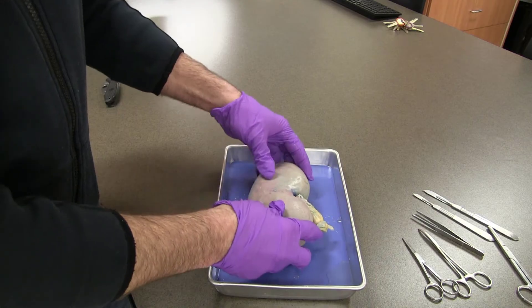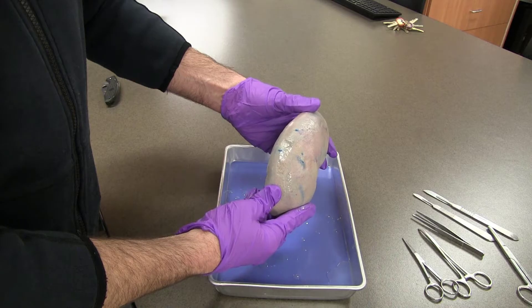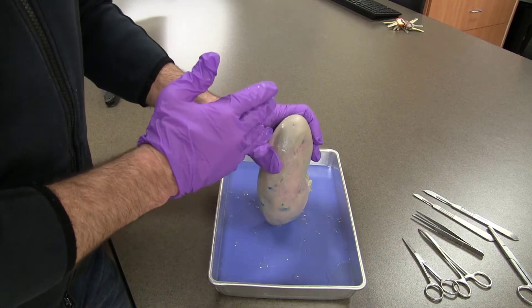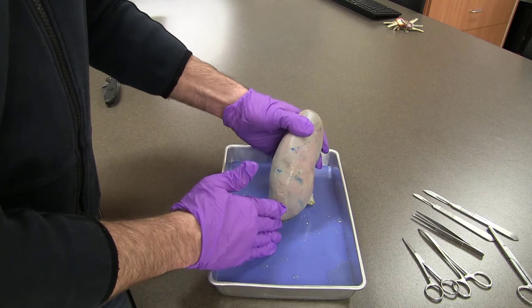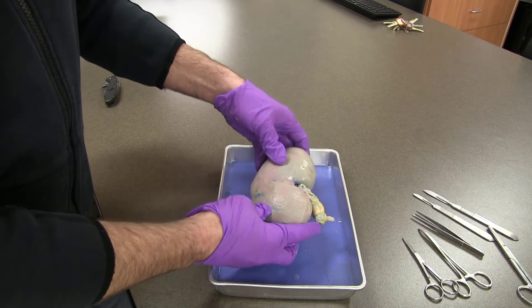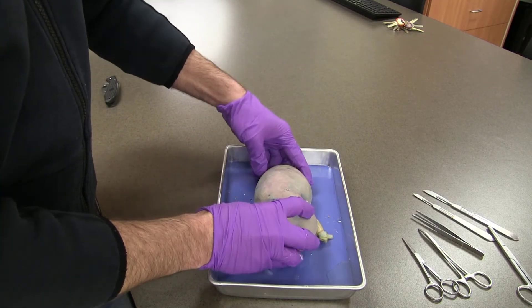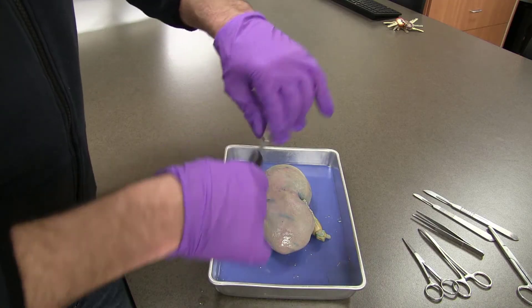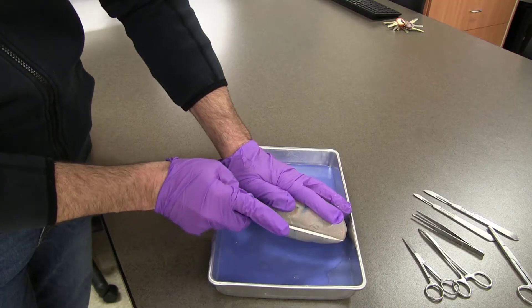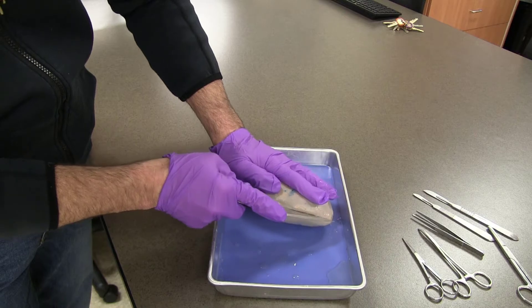So when we open this up we'll expect to see that in those areas. These work out pretty well a lot of the time, but there might be some uneven distribution. What I'm going to try to do is cut on the frontal plane and try to get in between all of the major or minor calyces, or as many as I can. I'm going to use a larger knife because this will allow me to make a more even cut through this kidney.